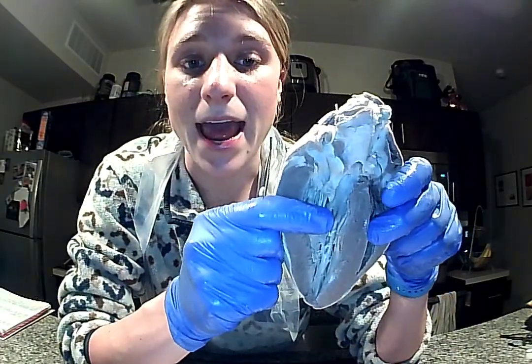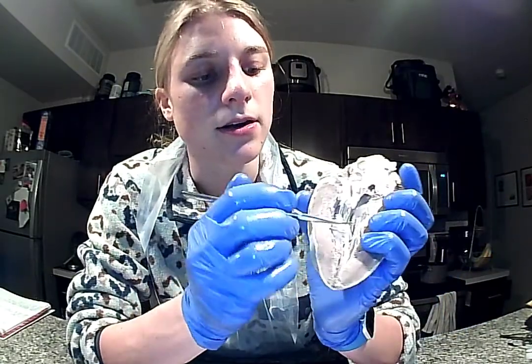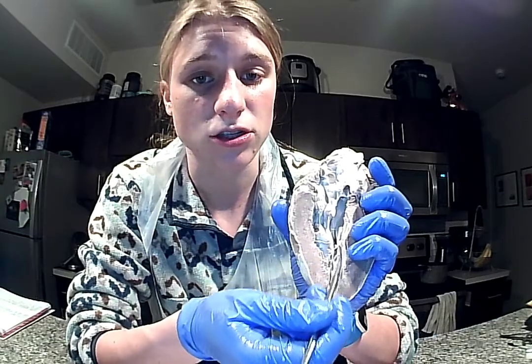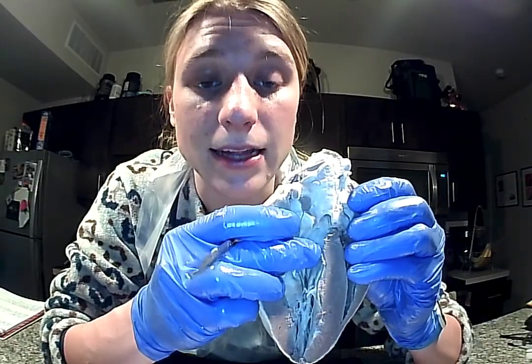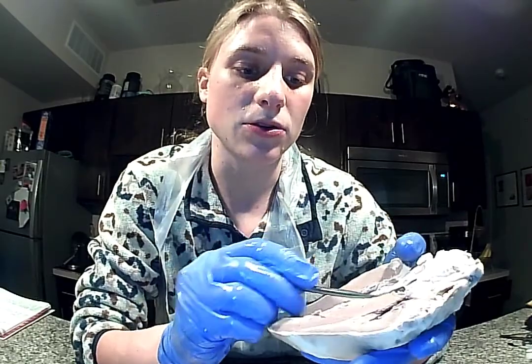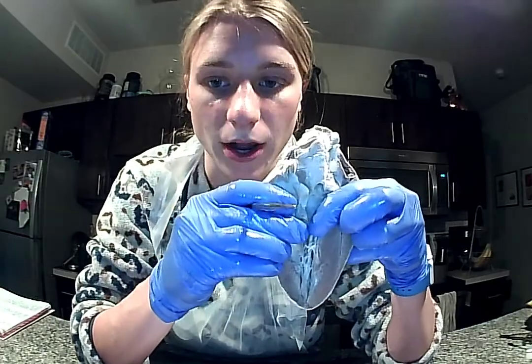Next, we have our endocardium. So the endocardium is the layer of the heart that is going to surround the internal features. So as you can see kind of right here, inside of the atrium and the ventricles, there is some tissue that surrounds those insides, and that is going to be the endocardium.